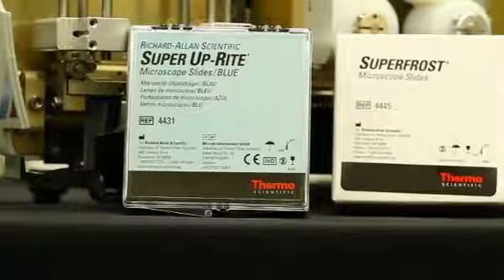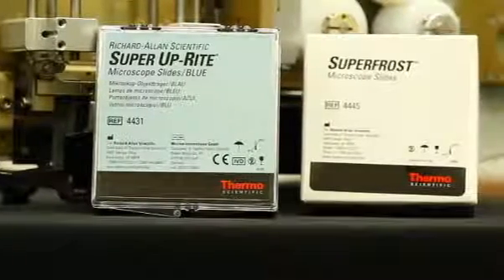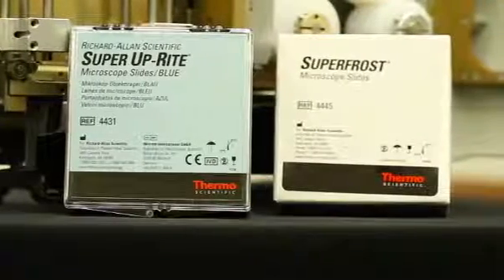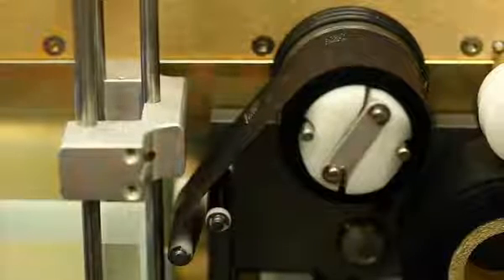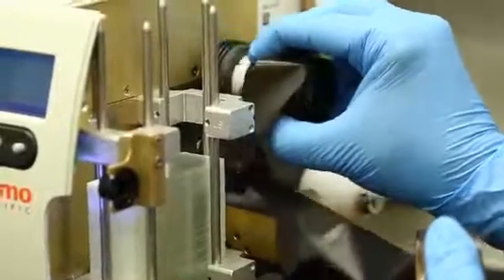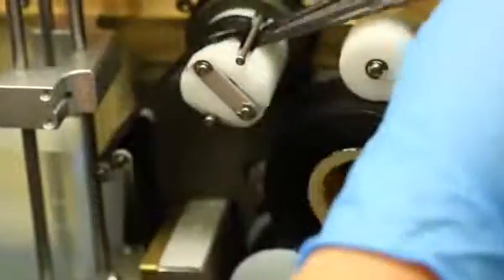If you are having poor printing, make sure you are using approved slides. Refer to the list shown in the back of the SlideMate Operator Manual. Another common cause of poor printing is an excessive amount of used ribbon on the pickup reel. If this is the case, follow the steps for removing and replacing the ribbon spool, shown earlier.